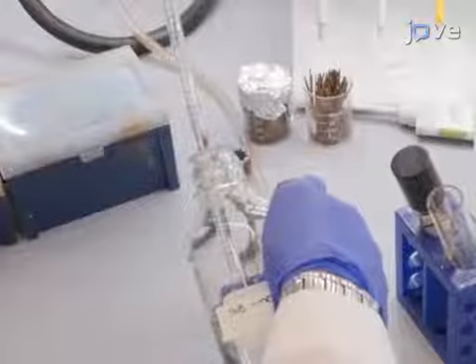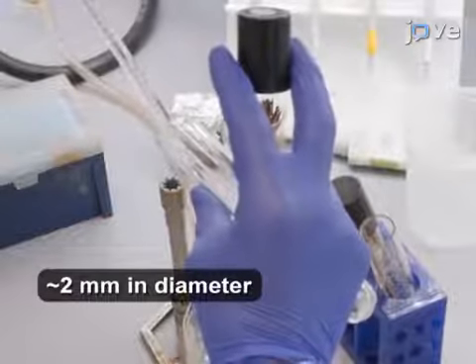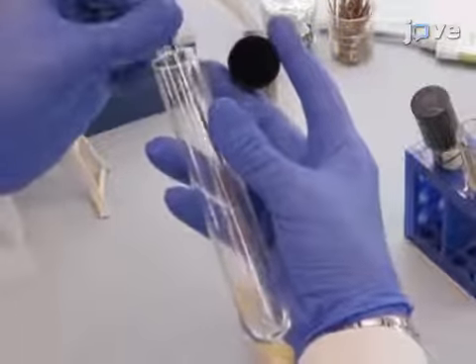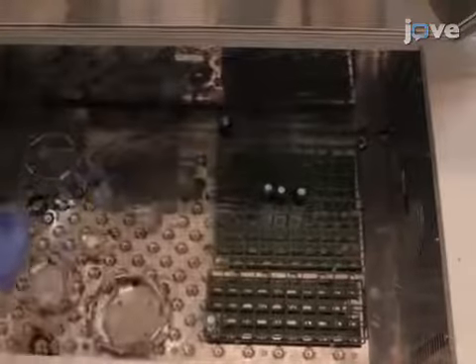After preparing solutions and media according to the text protocol, inoculate 2 to 3 colonies of yeast cells in 5 milliliters of YNB medium, lacking additional nutrients for maintaining plasmid selection. Grow the cultures at 30 degrees Celsius with shaking for 16 to 24 hours.